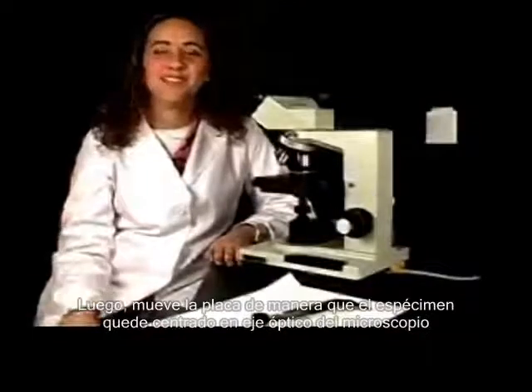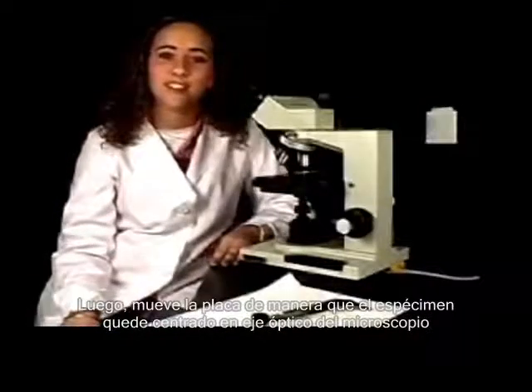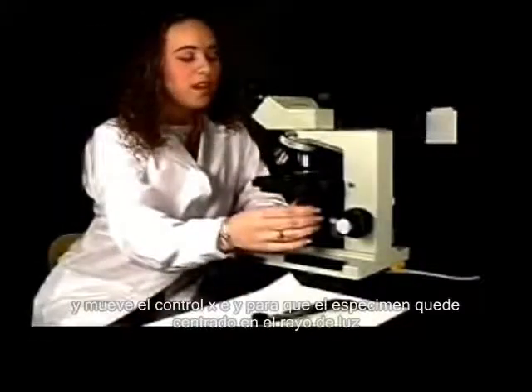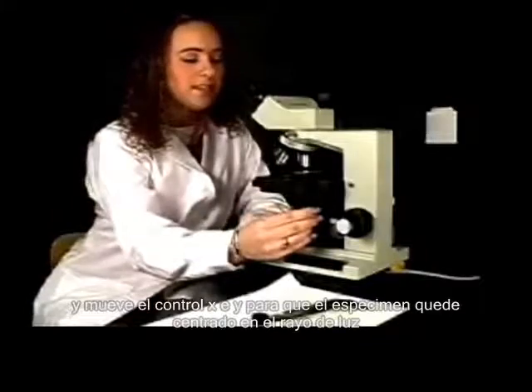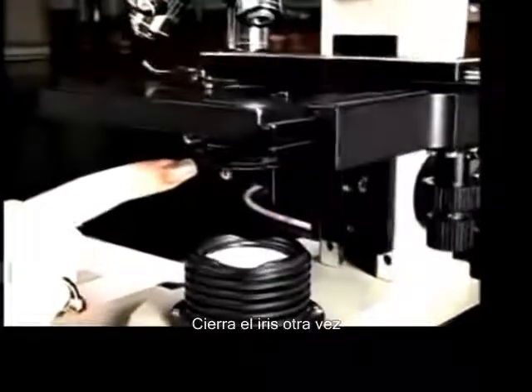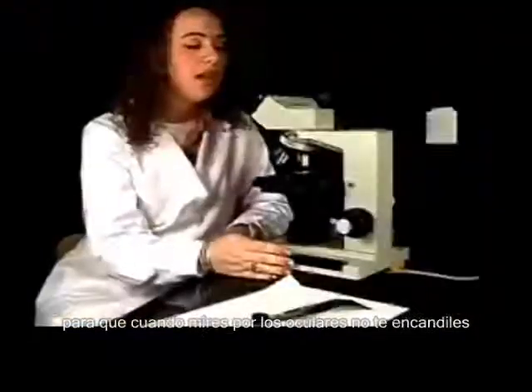Next, we're going to move the slide so that the specimen is centered in the path of light coming through the microscope. Open the iris and move your XY controls so that the specimen is centered in the light beam. Close the iris again so that when you look through the oculars, you do not blind yourself.